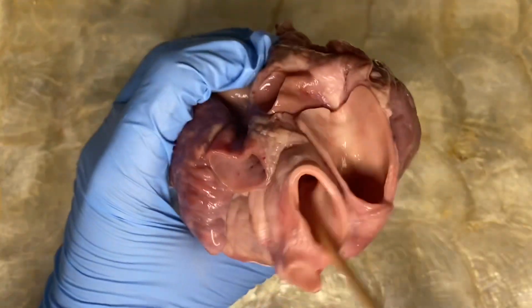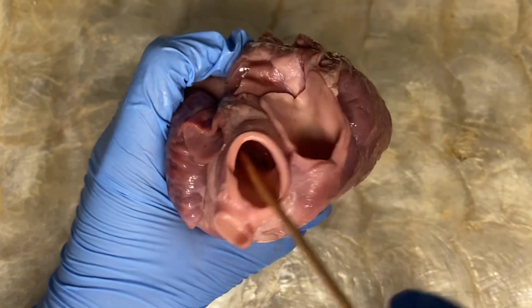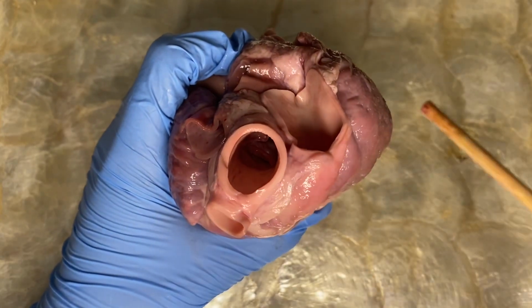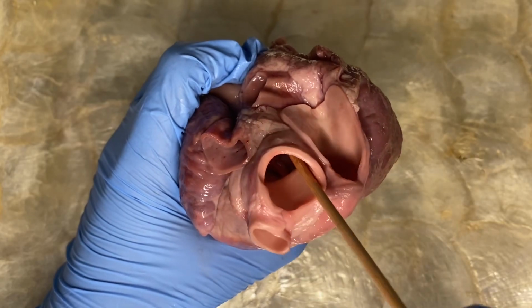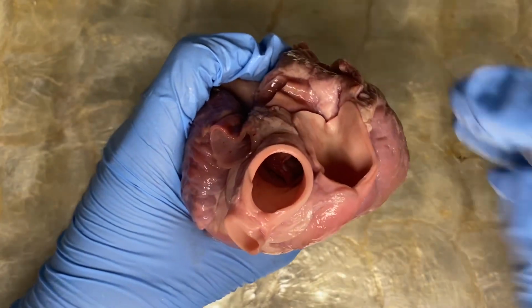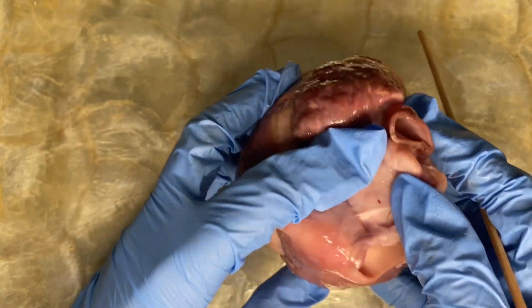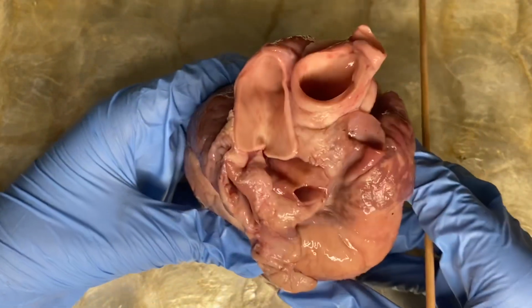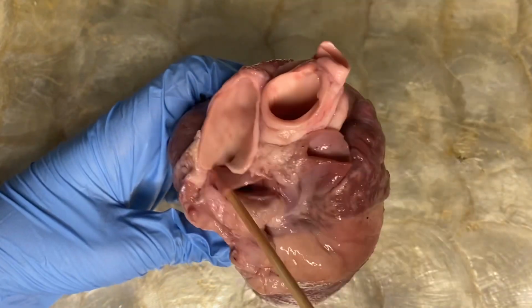This part is called the aorta, and this major vessel is located near the right atria and just behind the pulmonary arteries to the lungs. Now, let us locate the curved part of this vessel known as the aortic arch. Okay, this part is the aortic arch. Moving on, let us locate the pulmonary veins. Our pulmonary veins are here.